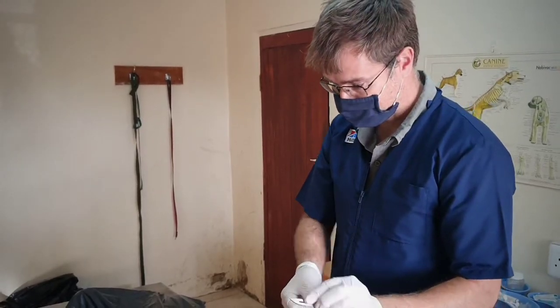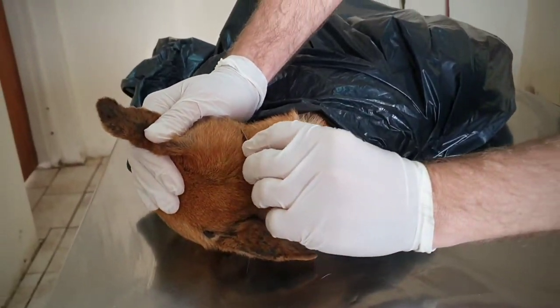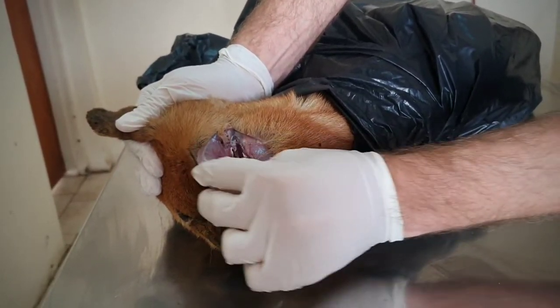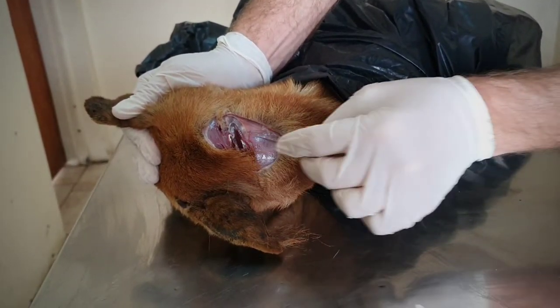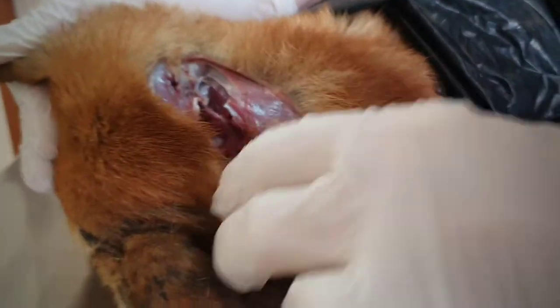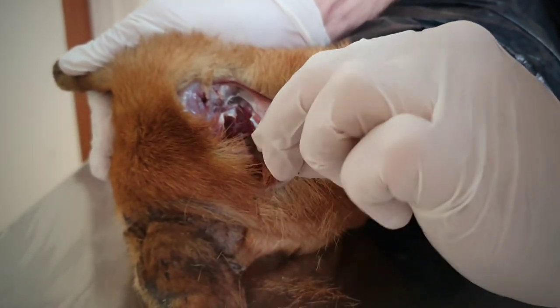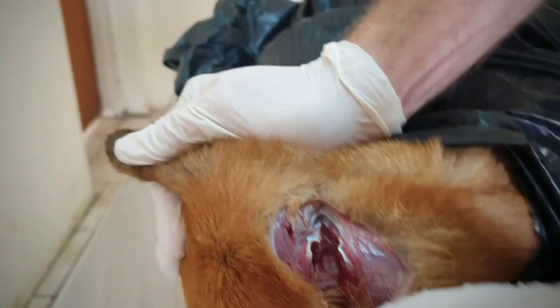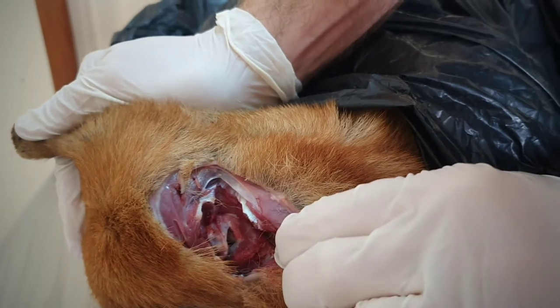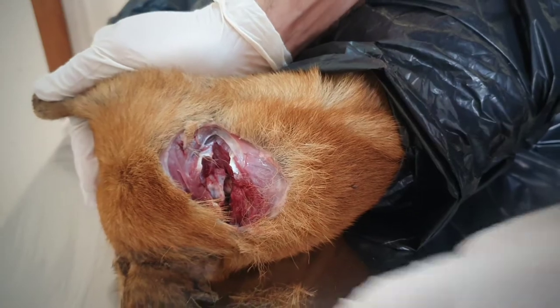So then just a quick recap. Where the neck muscles meet the base of the skull, we do our cut through there. You can actually see the muscles change direction — the muscles of the neck and the muscles of the base of the skull. There is that membrane I was talking about. Cut through the membrane. A bit of cerebrospinal fluid runs out and then you've got your gap for access.